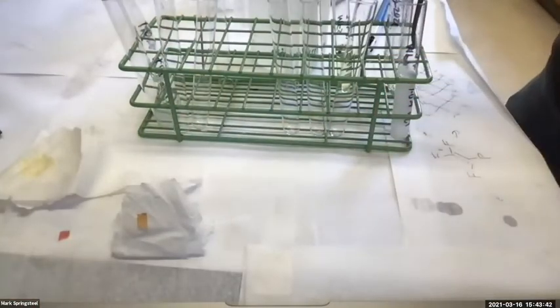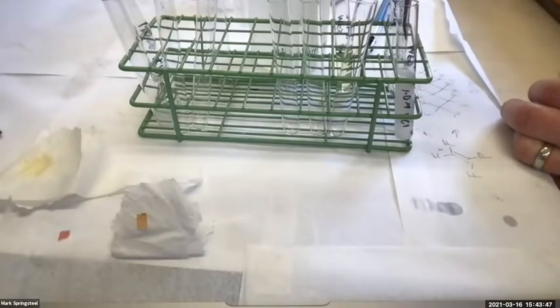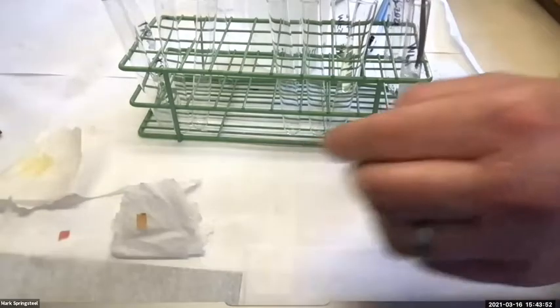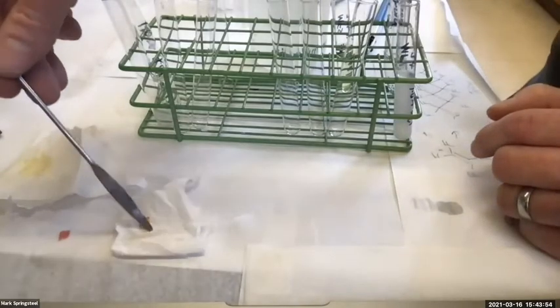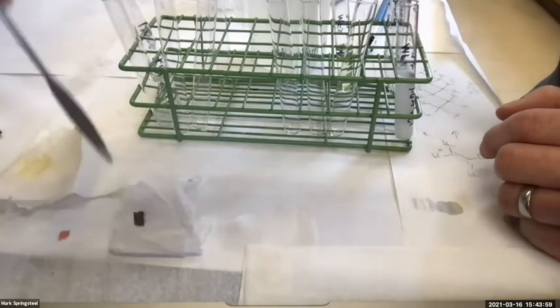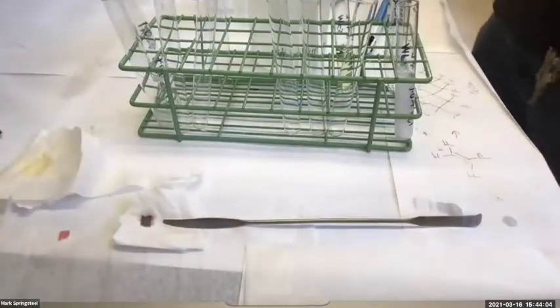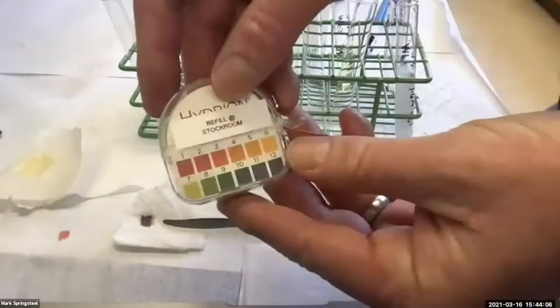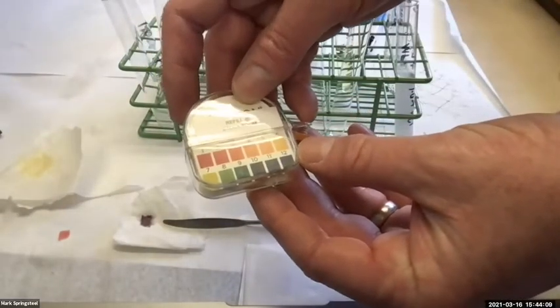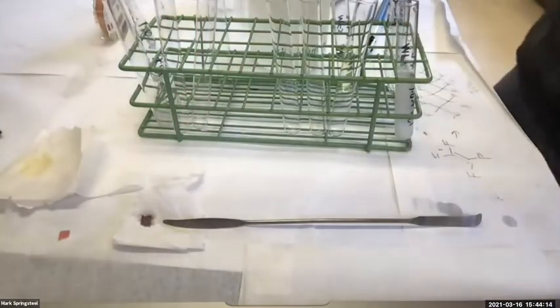So if I just barely tap in here, I might get a bad reading. Can you guys see this? If I just tap like that, I'm not going to get a good reading. I want to put it in there, swirl it around, and really get it coated with what I'm testing. Bring it over and check it. Oh, I think it's basic. Looks good. Well, it's kind of purple. Let's see. Yeah, no, that's pretty basic. I don't know, man. I've got a gut instinct. I want to add a little more. Let me try.